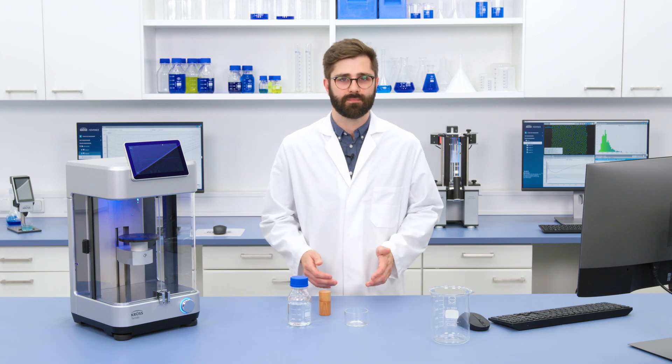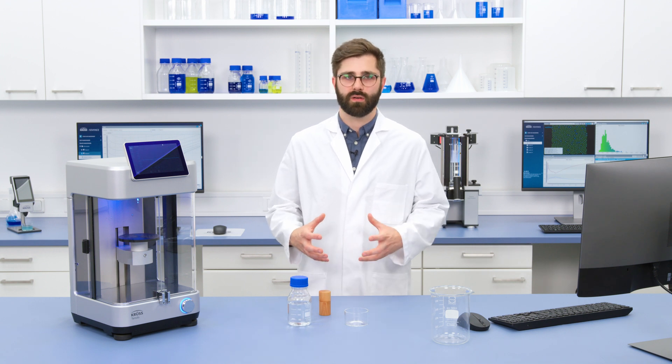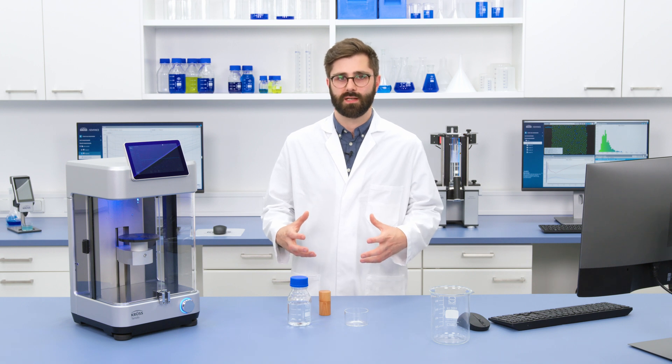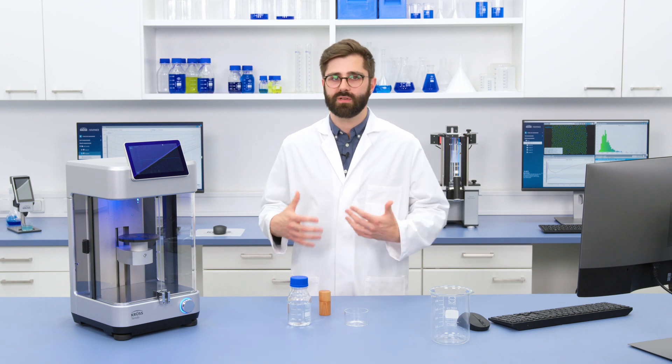Hi, it's Andy from KRÜSS. In this video we're going to get a bit more hands-on with Tensio and take a look at one of the core measurements you can do with the instrument. We're going to look at what tensiometry is really named for: measuring surface tension of liquids. The simplest questions are often the hardest to answer, and one I get asked a lot is: why do we want to measure surface tension in the first place?